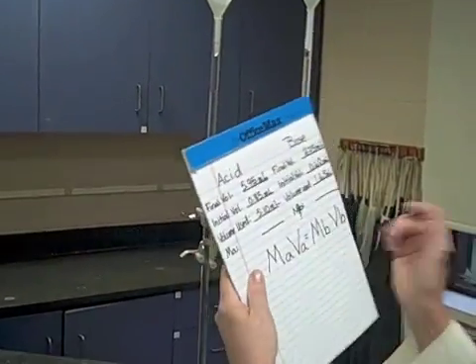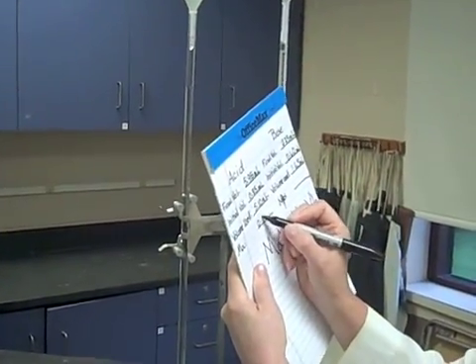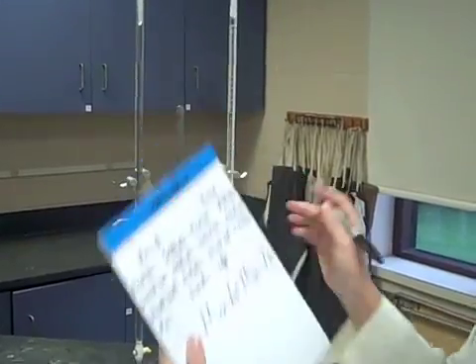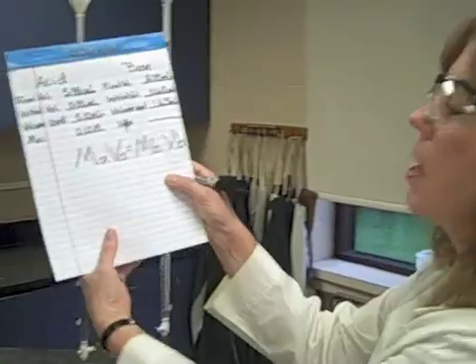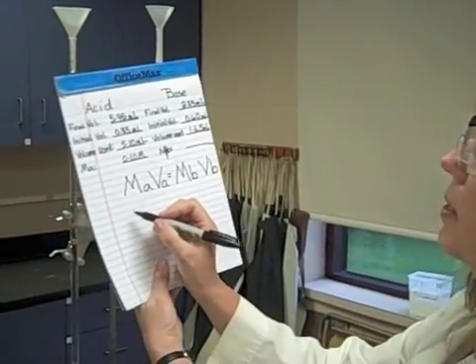Now, the molarity of the acid should be given to you in the event. And according to this bottle, I had 0.10 molar HCl. So, now you can see I only have one variable missing.